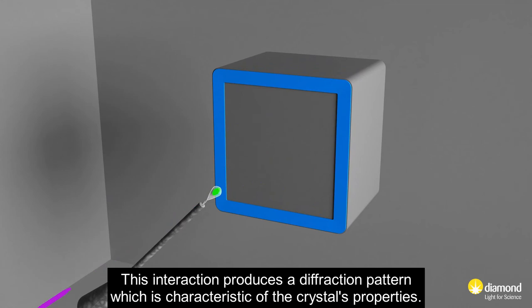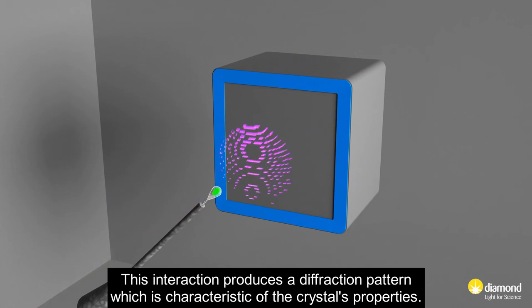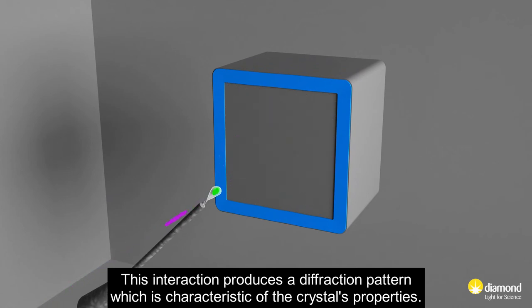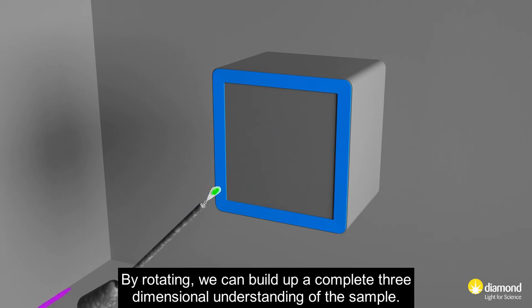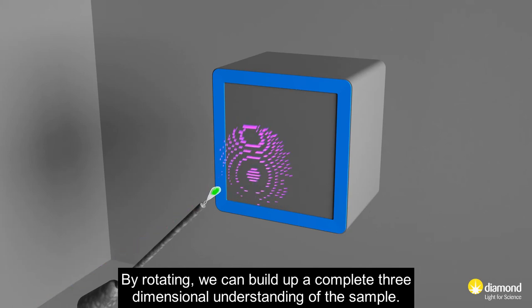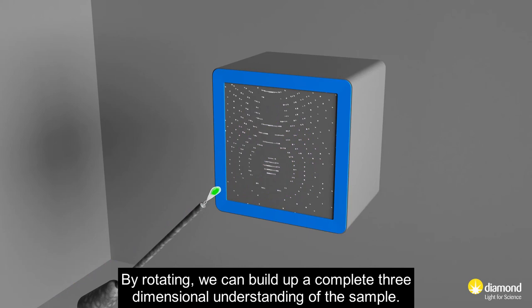This interaction produces a diffraction pattern which is characteristic of the crystal's properties. By rotating we can build up a complete three-dimensional understanding of the sample.